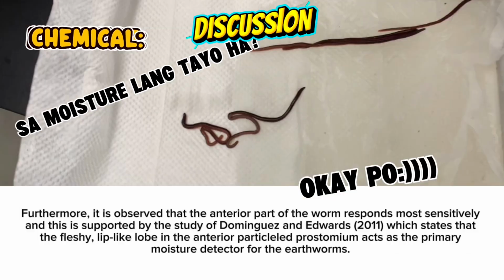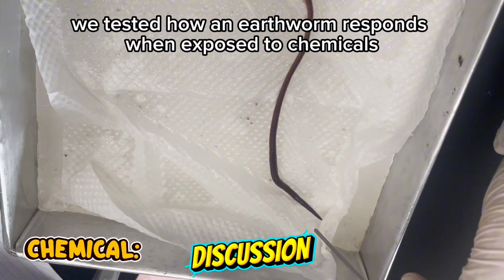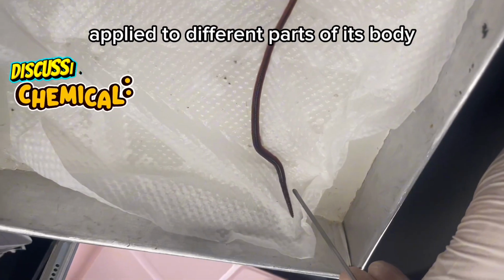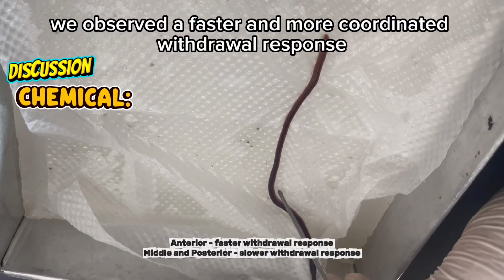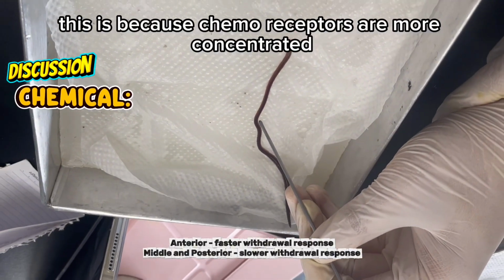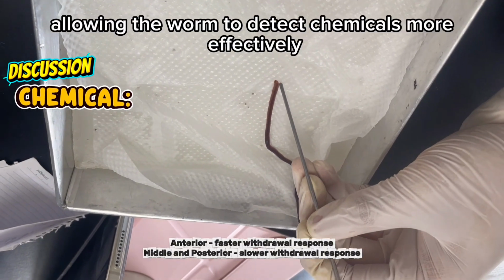Okay. For this part, we tested how an earthworm responds when exposed to chemicals, specifically the substance xylene applied to different parts of its body. As you can see, when xylene was applied to the anterior region, we observed a faster and more coordinated withdrawal response. This is because chemoreceptors are more concentrated near the anterior end, allowing the worm to detect chemicals more effectively.